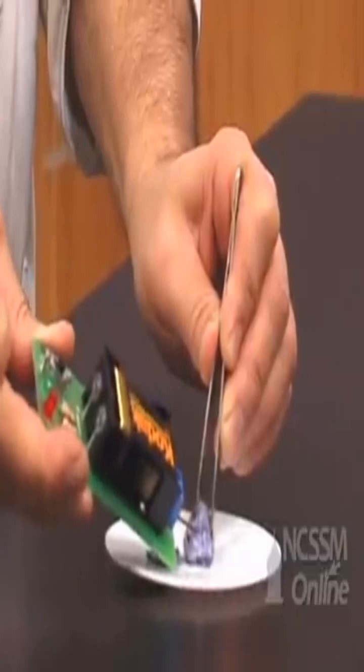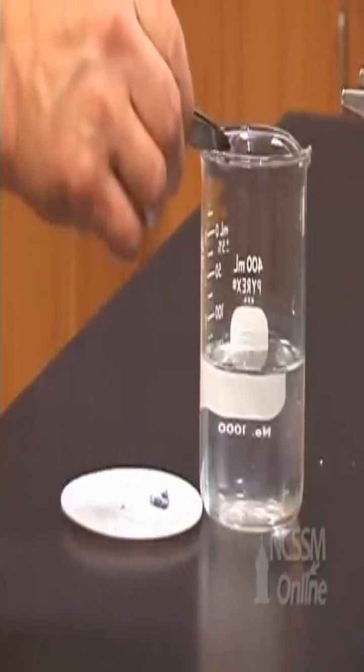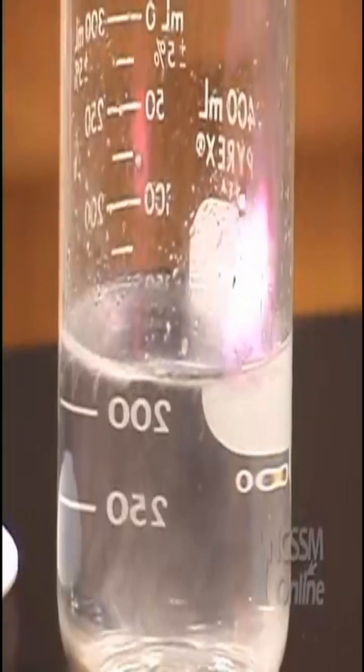The potassium is a metal and is an excellent conductor of electricity. If we add a piece of potassium metal to water, we see that it reacts much more rapidly with the water.